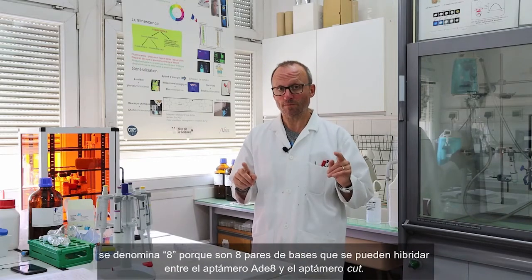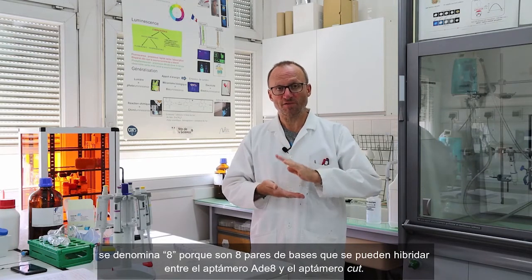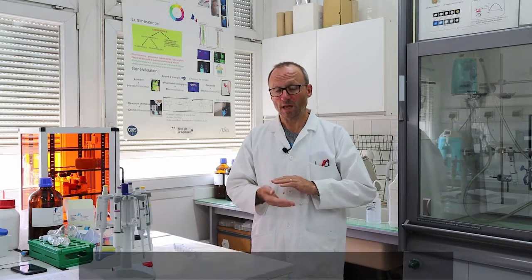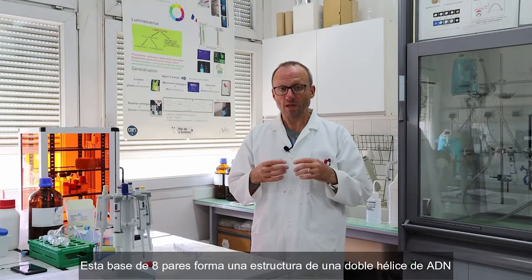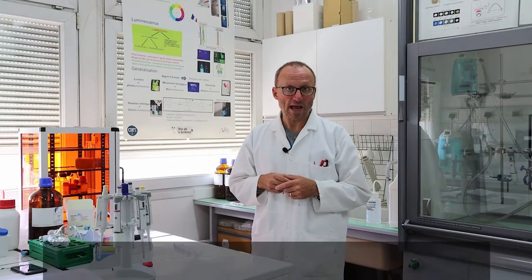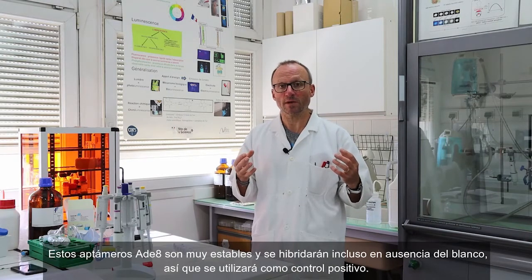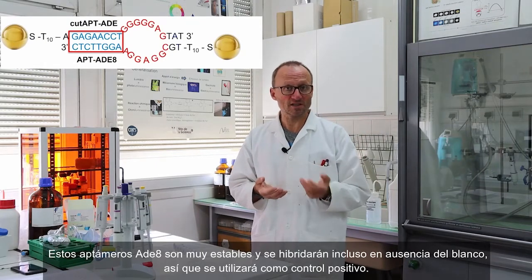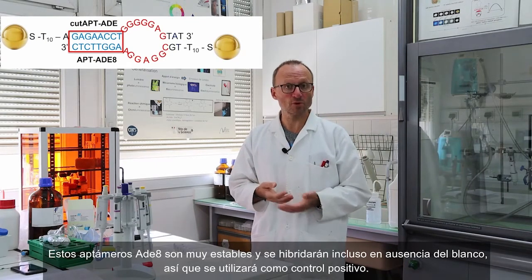Okay, and the last control will be made with the adenine 8 aptamer, which is much longer. It's named 8 because there are 8 base pairs that can be formed between the adenine 8 aptamer and the cut aptamer. These 8 base pairs, they are forming a stem made of a double helix DNA, and it will be very stable. Okay, it will be so stable that it will hybridize even though there's no target. So it will be used as a positive control.